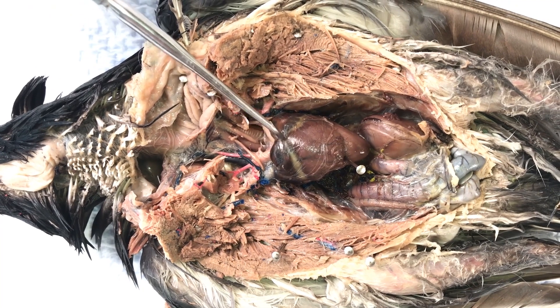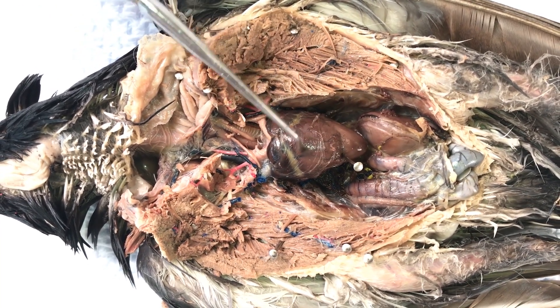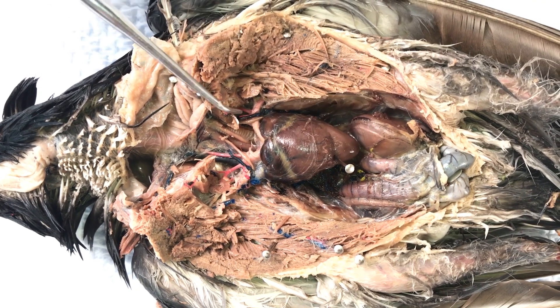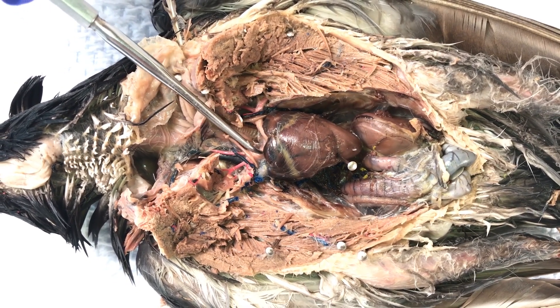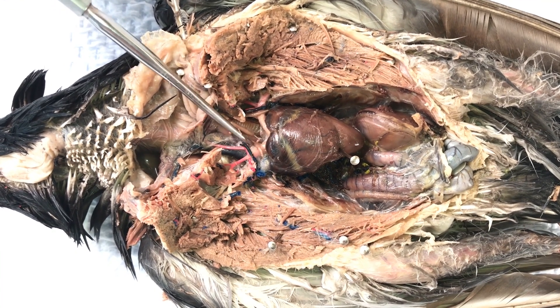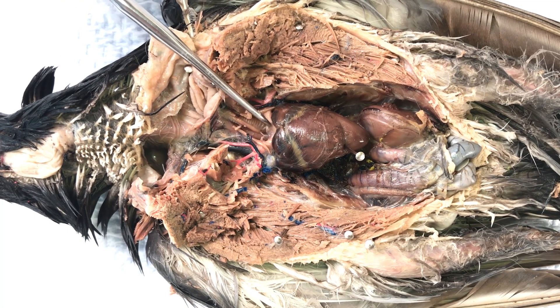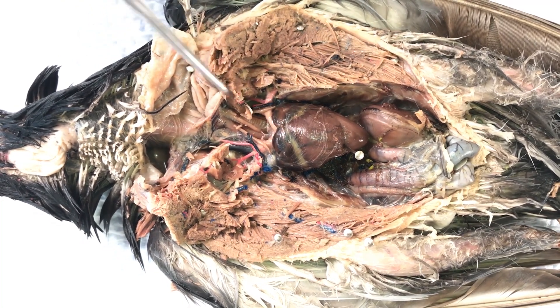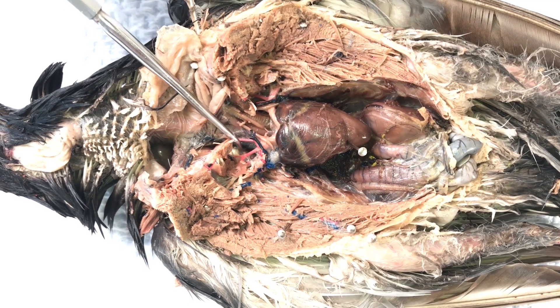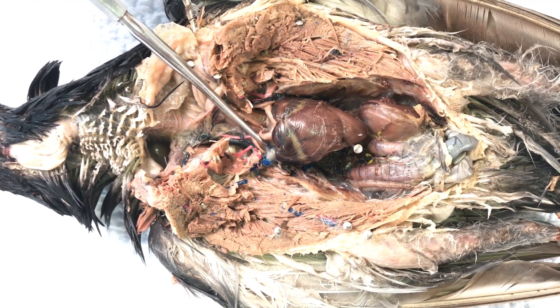If we look at the heart again, we have the right atrium, the left atrium, the right ventricle, and the left ventricle. We have the trachea that leads to the lungs. We have the brachiocephalic artery that leads off to the axillary artery, and the brachiocephalic on the other side, along with the pectoral and axillary arteries. The jugular vein is also visible below that area.